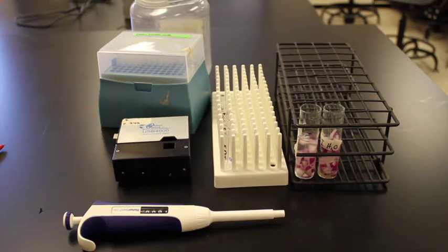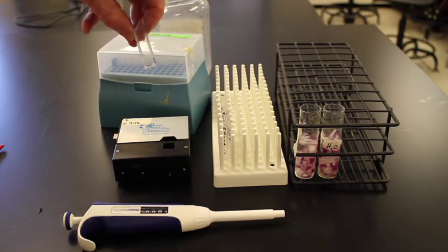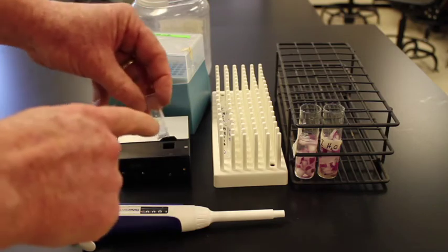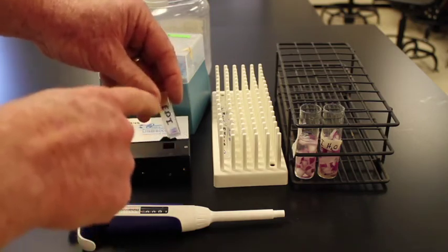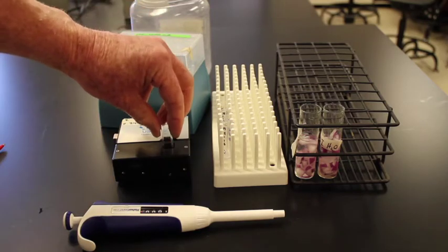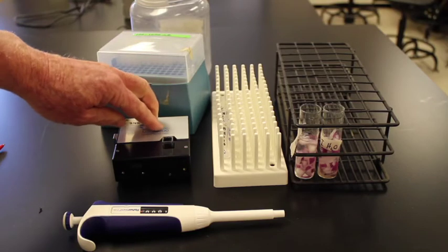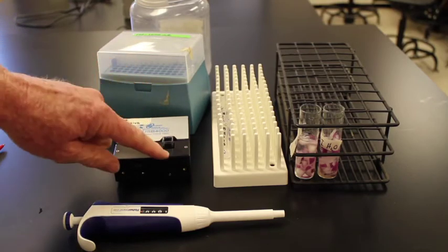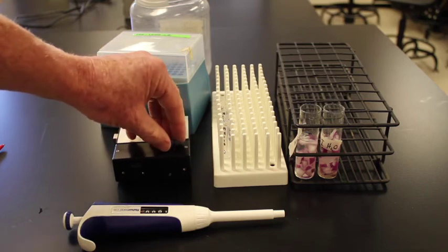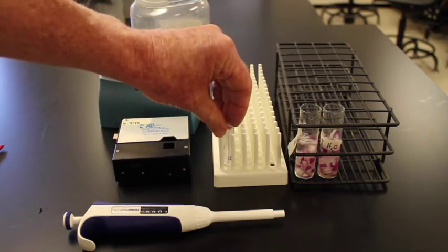To use a spectrometer, then I need these little features called cuvettes. You'll notice that the cuvette has a side that is clear and a side that has all these ridges in it. The clear side basically goes into the spectrometer where light shines through. The spectrometer knows how much light it is shining through. It knows how much light gets to the other side, and it then uses that information to estimate absorbance at whatever wavelength that we want it to use.